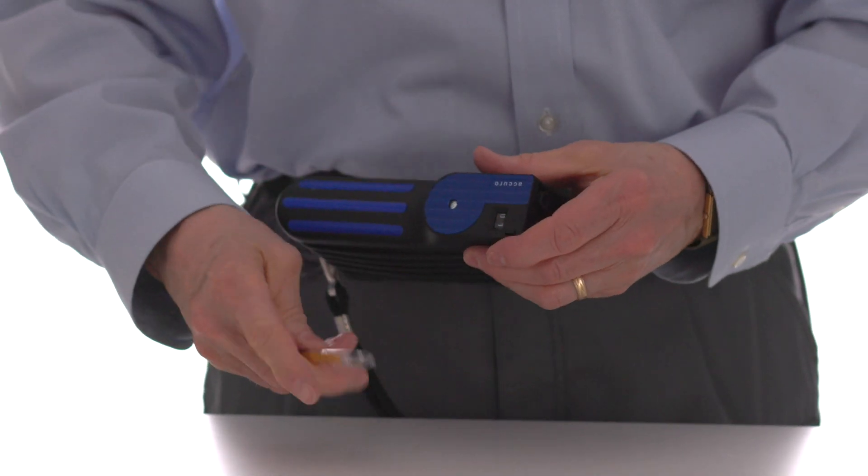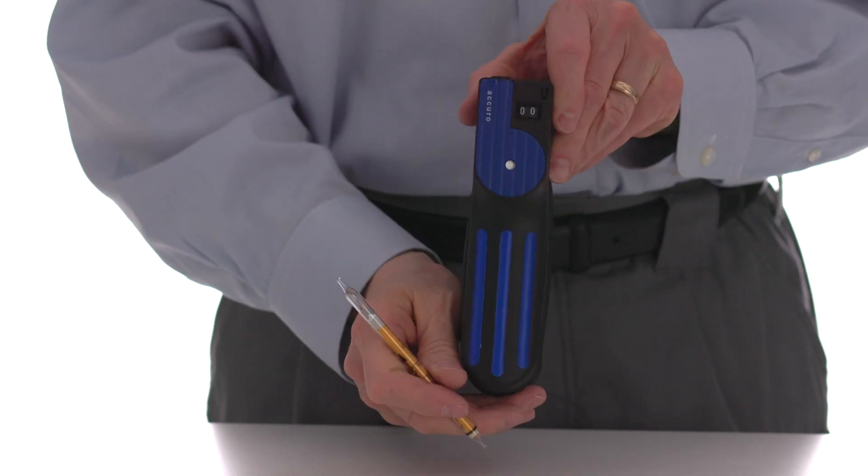Remove the tube and push the reset button to set the stroke counter back to zero.